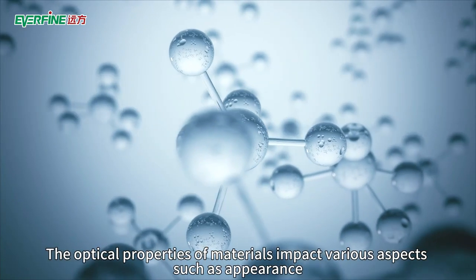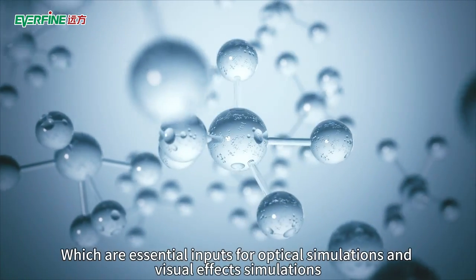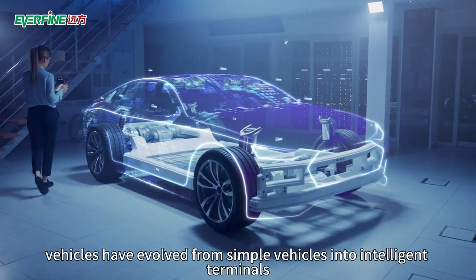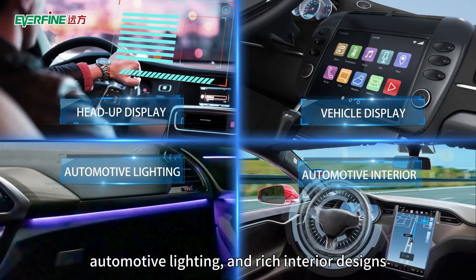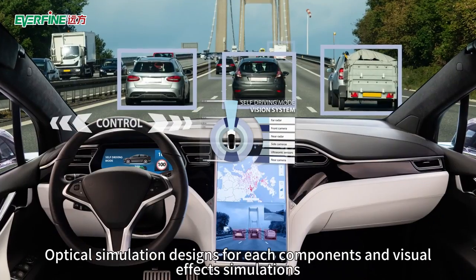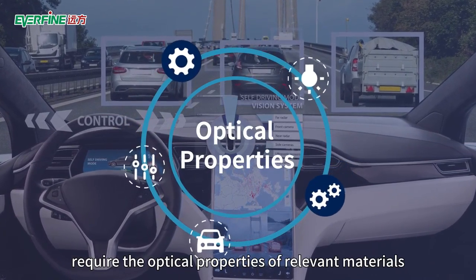The optical properties of materials impact various aspects such as appearance, visual effects, and optical functions, which are essential inputs for optical simulations and visual effects simulations. For example, vehicles have evolved from simple vehicles into intelligent terminals, and there are some features such as head-up display, vehicle display, automotive lighting, and rich interior designs for intelligent cockpits which can make lighting environments inside the vehicle complex and diverse. Optical simulation designs for each component and visual effects simulations require the optical property parameters of relevant materials.